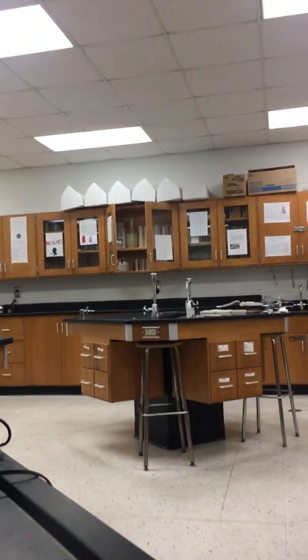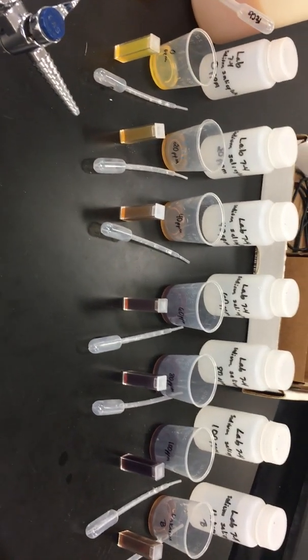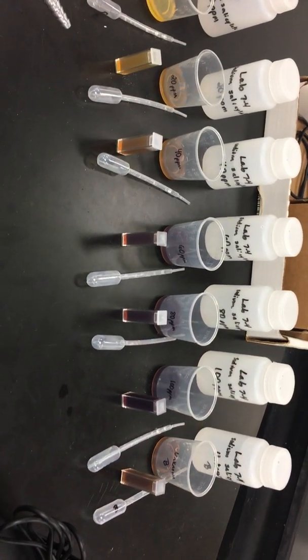I'm going to then add it into the cuvette. Hold on. Sorry. So I'm going to pour that into the cuvette. You fill it up pretty well, and then you add the top to it. All right. Wipe that off, but I'm going to set it up so you get a chance to compare it to the others real quick. All right, so here you have your ranges 0, 20, 40, 60, 80, 100, and your unknown.